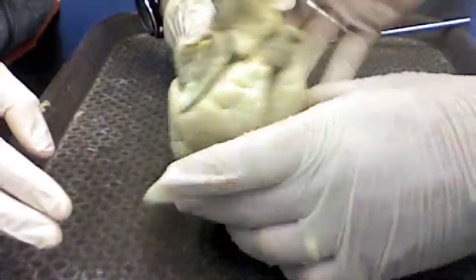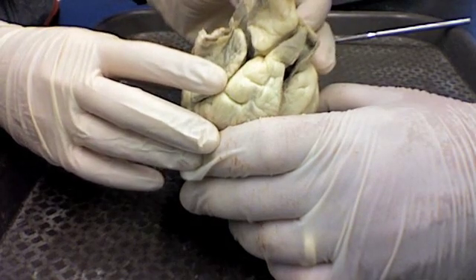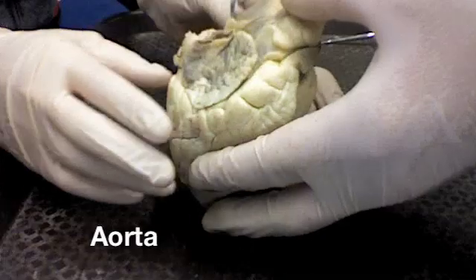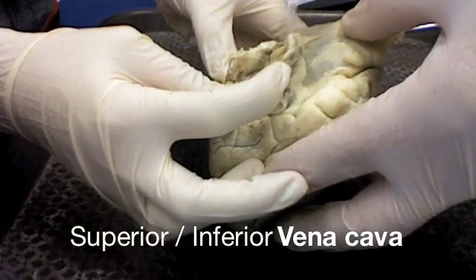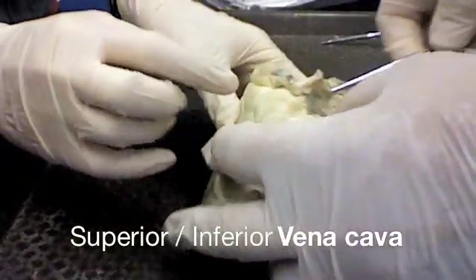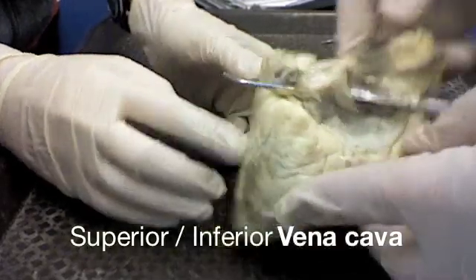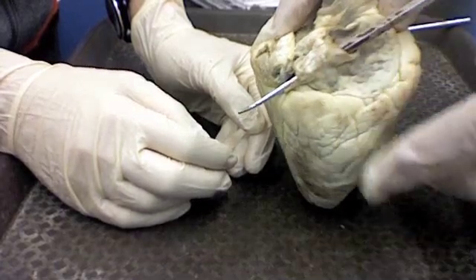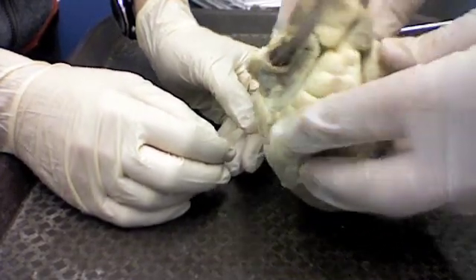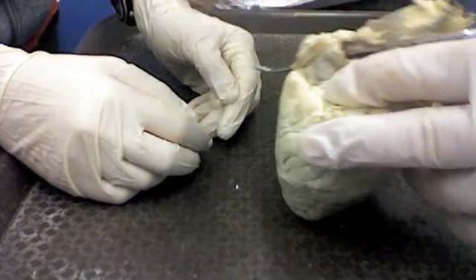Now if you look at the three things that you need to identify from a front view like this: the vessel closest to you is the pulmonary artery, which we've cut. The next one would be portions of the aorta or branches of the aorta. And then the third one would be the superior vena cava, which is this thing here — and that would be the right auricle or part of the right atrium. The superior vena cava and the inferior vena cava — you'd have to probe this to distinguish which is superior and which is inferior. In a test, there would be a probe stuck through it to show where it's going. So from the front you're looking at three things: pulmonary artery, aorta or branches off the aorta, and superior or inferior vena cava depending on whether you're on top or bottom.